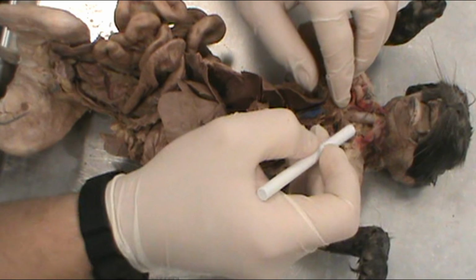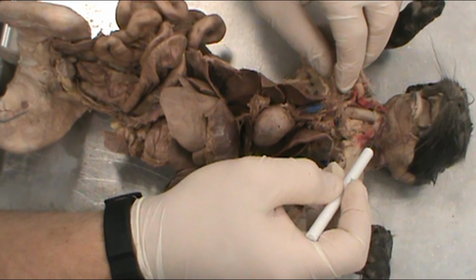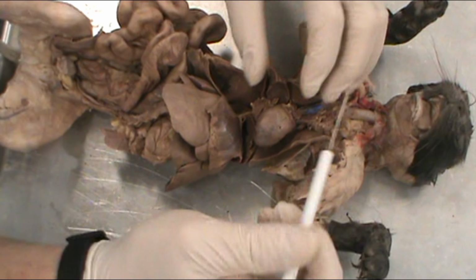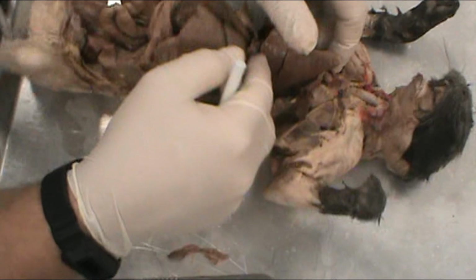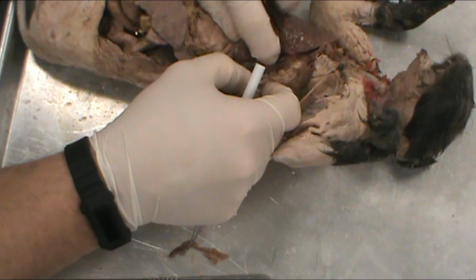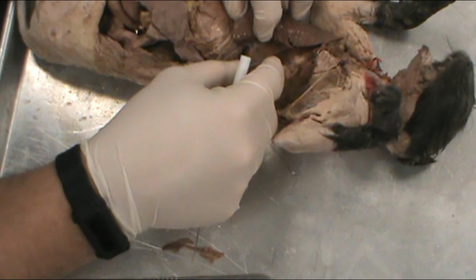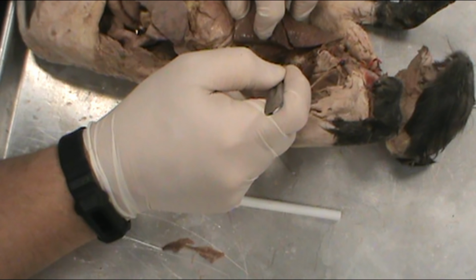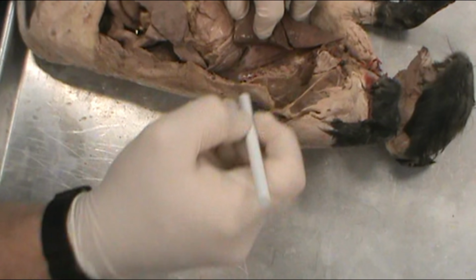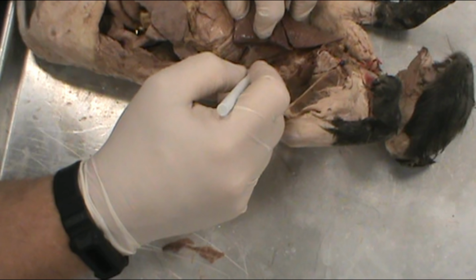All right. So, review real quick. Got trachea, larynx, superior vena cava, inferior vena cava, heart, and the lungs. The other major blood vessel that we have to identify is the aorta, and the easiest place to see the aorta is to pull the lung back, and it will be this big tube running right down the spine right here, and it is an artery, so it will be dyed pink.